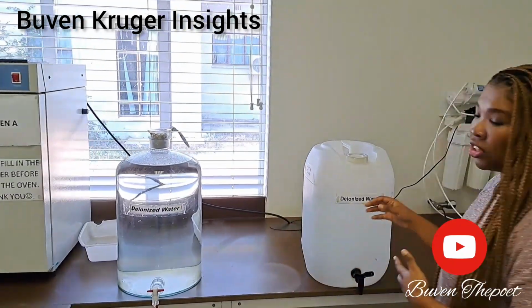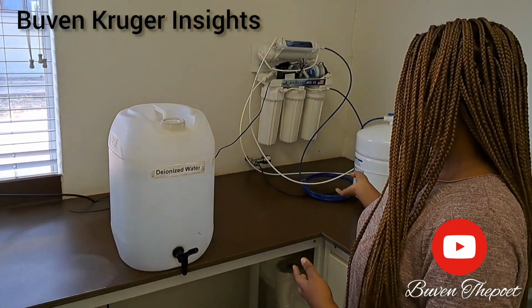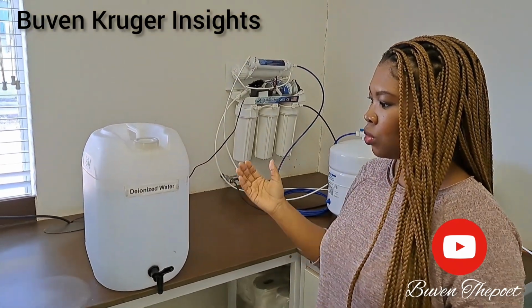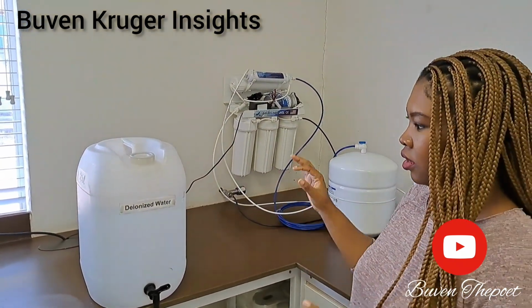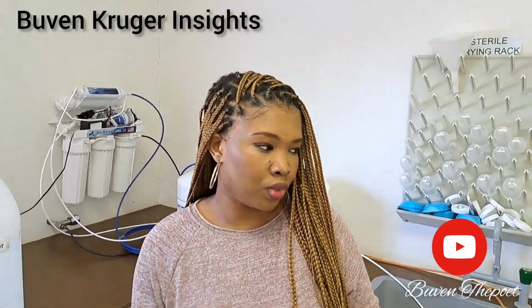And then we have a deionizing machine. This is what we use. What the deionizing machine does is that it deionizes water. If you want pure water and you don't want water from the tap, this is what they use.